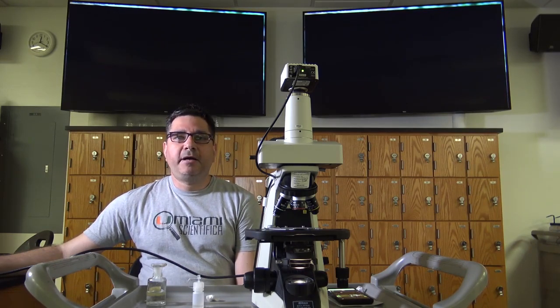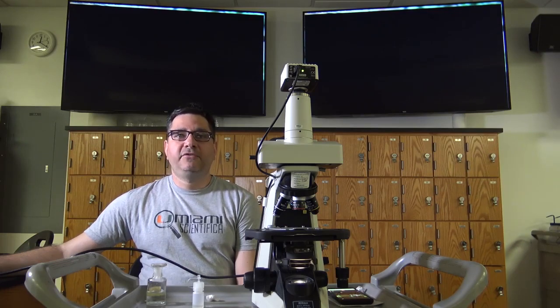To use the ethanol bottles, simply align the node on the cap with the node on the neck of the container. This will create a channel and allow the ethanol to flow onto your lens paper. Also, be sure that the objective is on the lowest magnification, the 4x, and that the power is turned off on your scope. Never raise the stage with the coarse adjustment knob when either the 40x or 100x objectives are being used. You may unknowingly raise the stage too far and damage both the scope and your slide.